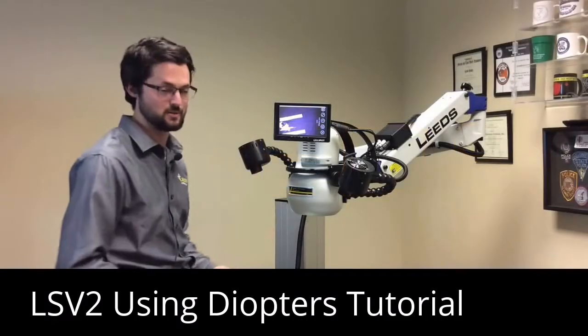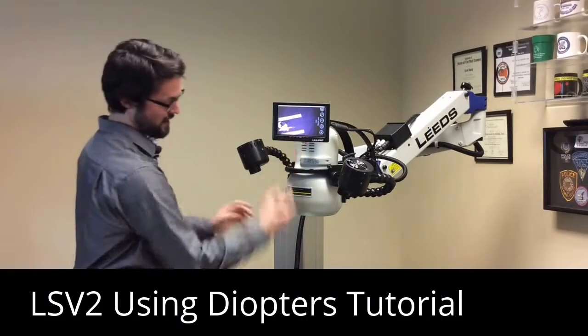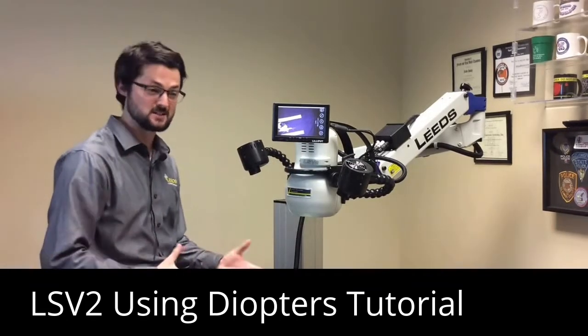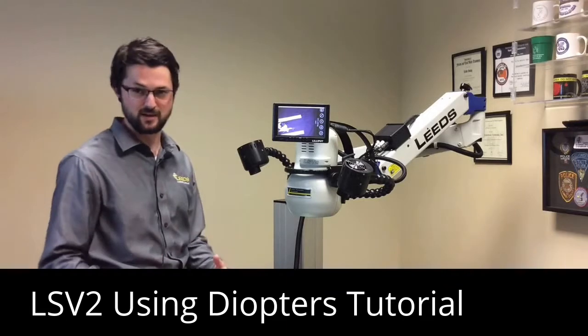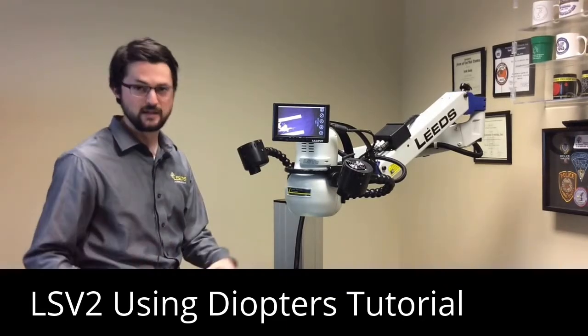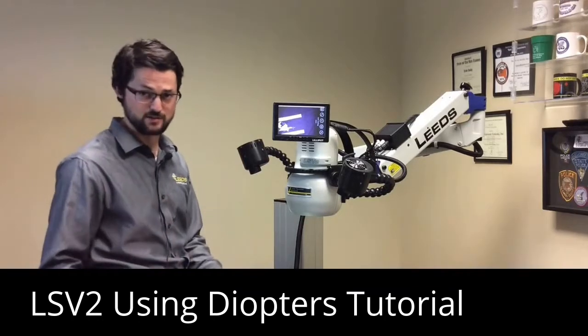What does it look like? Well, I'm going to show you. Right now we're at the plus 2 diopter range, which is where I would say 70% of the time people spend their time. General screening — it's got a good balance between field of view and also sensitivity of fluorescence.